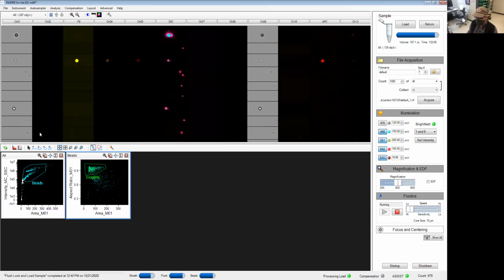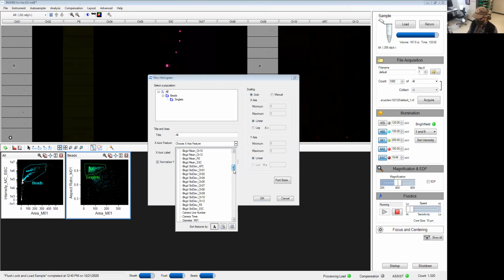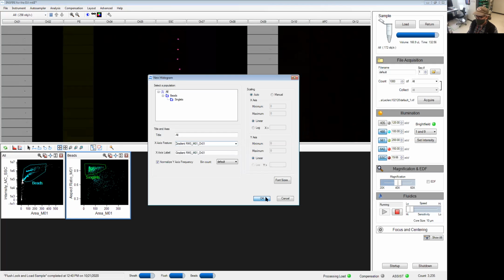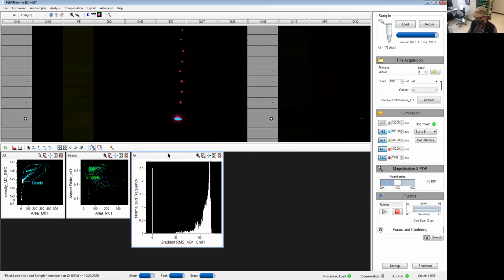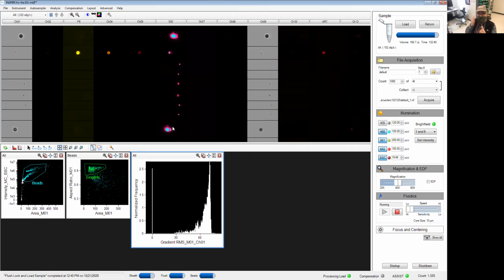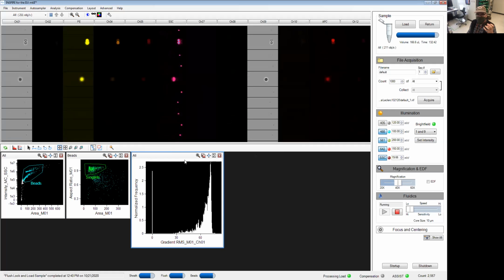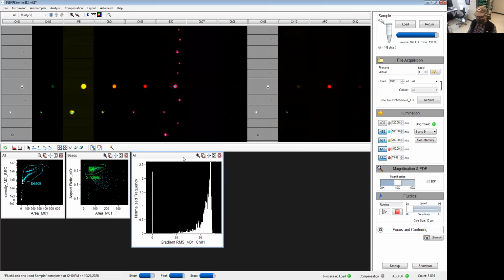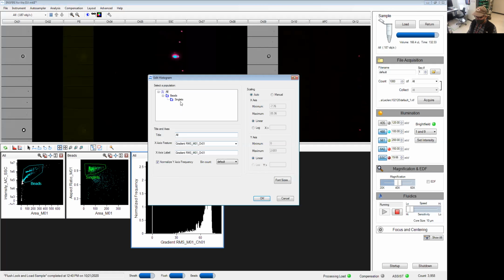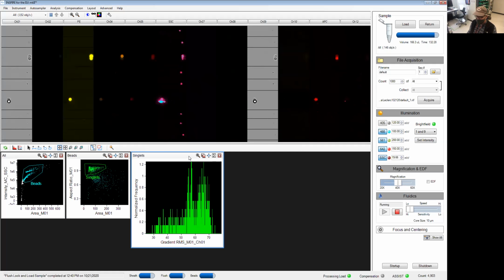All right, next window, we're going to use a histogram this time around, and I'm going to use something called the gradient RMS on channel 1. And here what we're trying to do is get all the pictures that are in focus. So the cells are not always running exactly at the focus point generated by this hydrodynamic focusing. Some images will be very sharp, very great to use. Some of them will be kind of fuzzy, and you don't really want them in your analysis. So what we're going to do is basically tell the software to discard or not count these events going further.